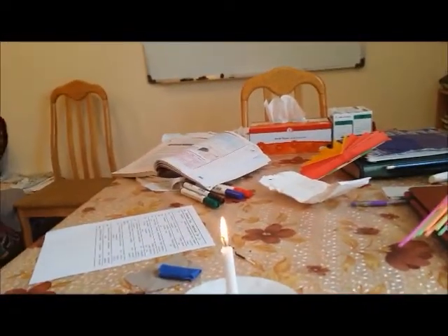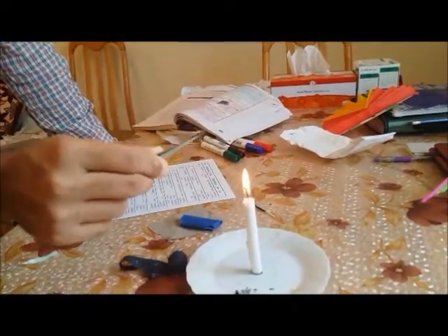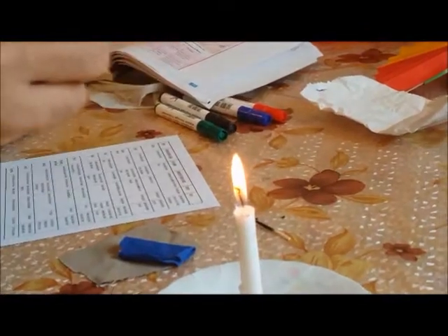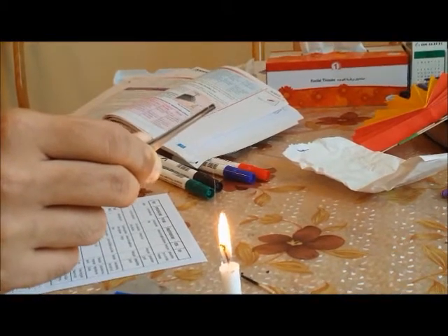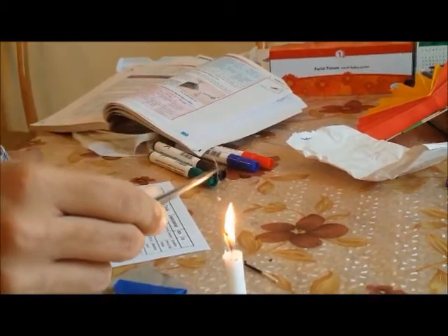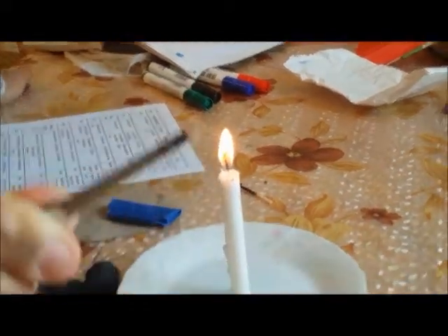Here is my very long type of fabric. Let me see what happens to this when brought in front of the flame. You see, it's trying to curl up but not burning — just trying to curl up. Just curling. Not burnt, curled — a long thread curl.